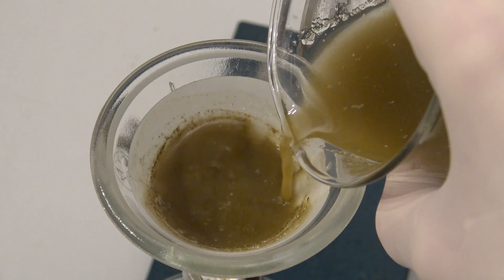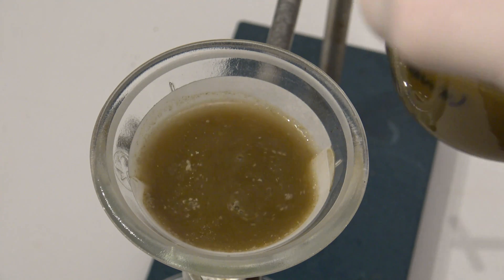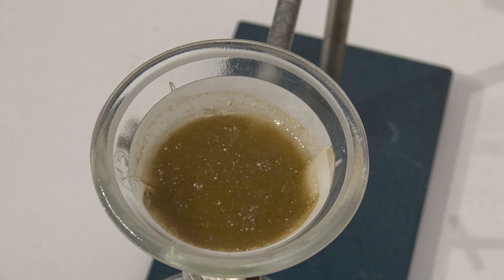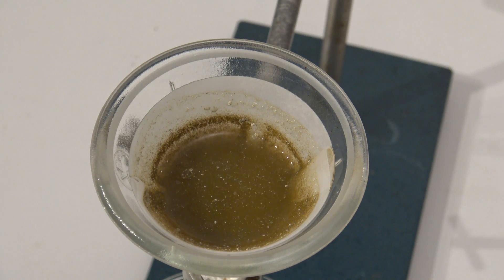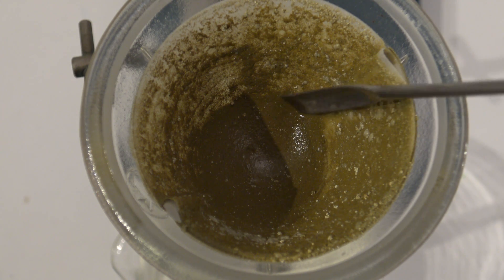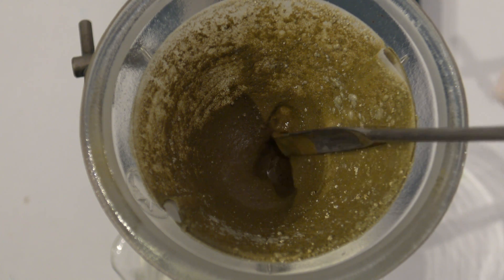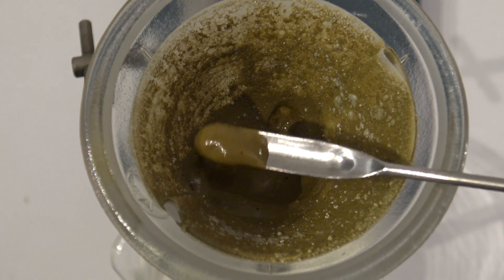This took quite some time, so I would do a vacuum filtration the next time. The siloxene should be used immediately for the following experiments, because it slowly oxidizes in air.